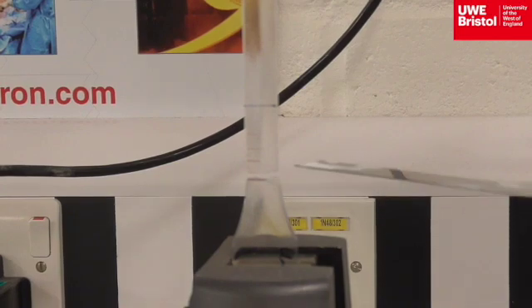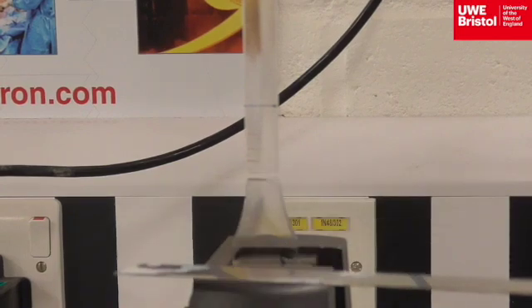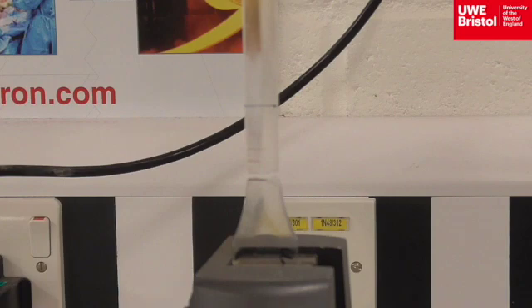Note at the fracture there is a gap between the two halves. At point of fracture, the two grips do not move. That gap is caused by residual elasticity in the material trying to get back to its original shape and size. The smaller the gap between the two halves of a fractured polymer suggests the more brittle the polymer is, and if there is a large gap, it can be deduced the polymer is very ductile.